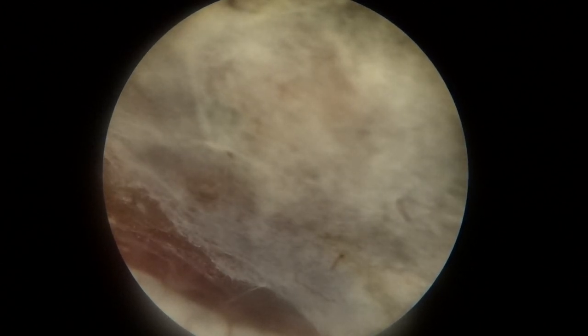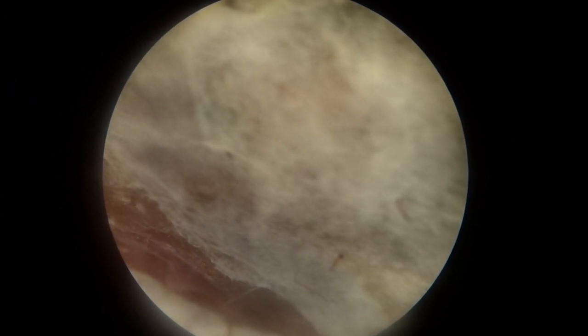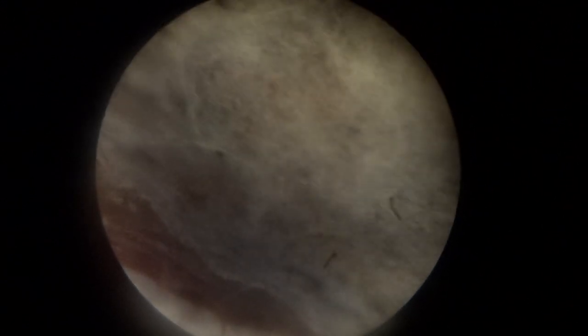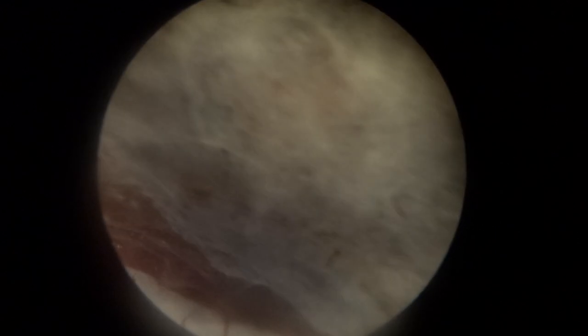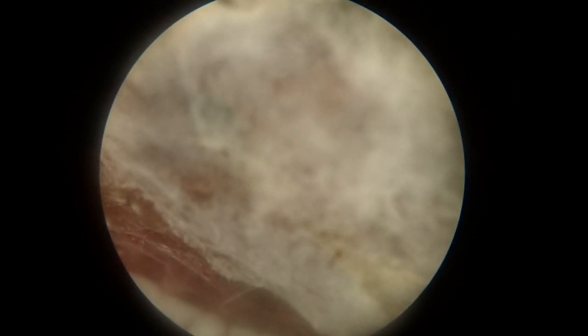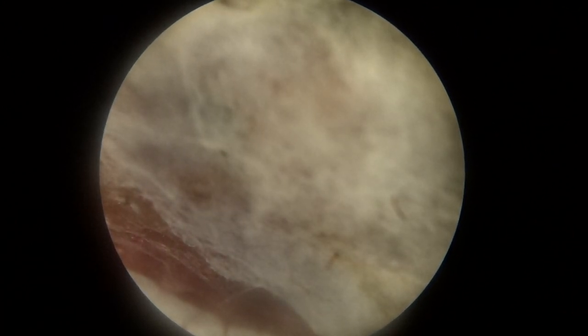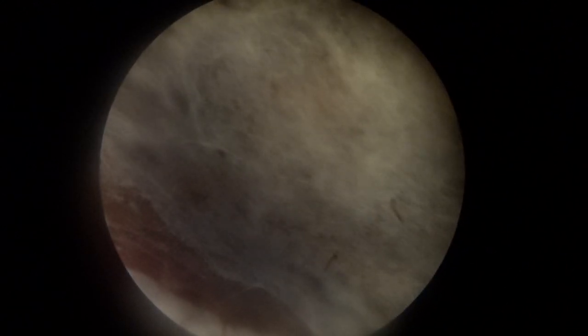Fungi produce hyphae. Hyphae release digestive enzymes in order to absorb nutrients from sources. Hyphae transport nutrients to other parts of the fungus body, which is called the thallus. Hyphae may become bound together or modified to form mycelium, as you see here under the stereomicroscope. Mycelium is a root-like structure of a fungus consisting of a mass of branching, thread-like hyphae. A single spore germinates into mycelium, which cannot reproduce sexually. When two compatible mycelia join, often a mushroom is formed. Mushrooms are the fruiting bodies of fungi and release spores into the air to continue the species.